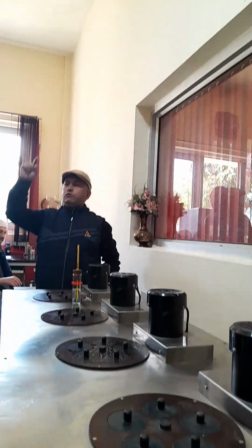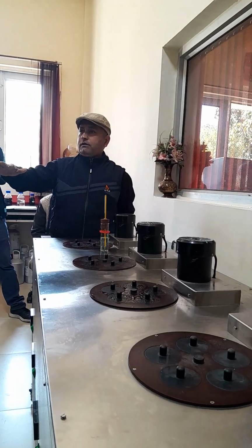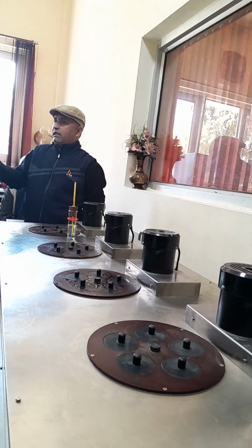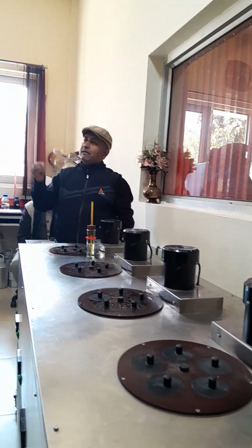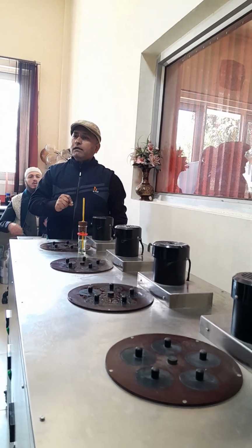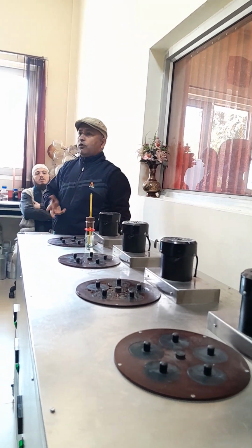So that much margin should be there, so that once you switch on and it starts heating, it converts into liquid. So 3 degrees is required. There is no other answer, because in literature it is written that when you are reporting the pour point, it will be a multiple of 3. So that is why we are adding this. No other answer is there.